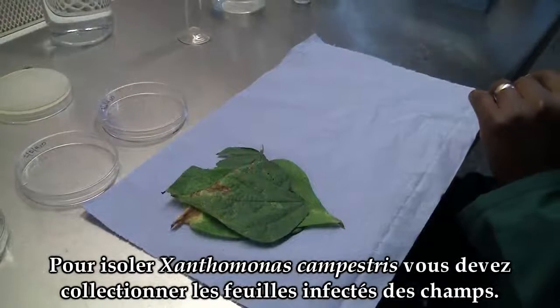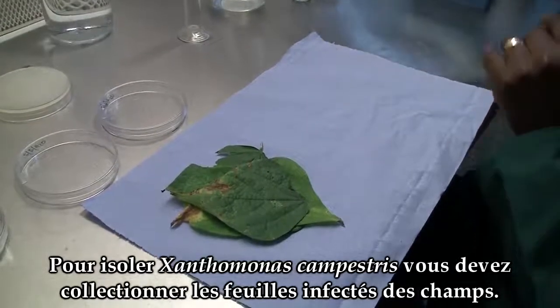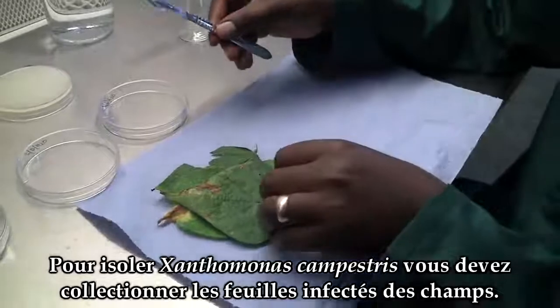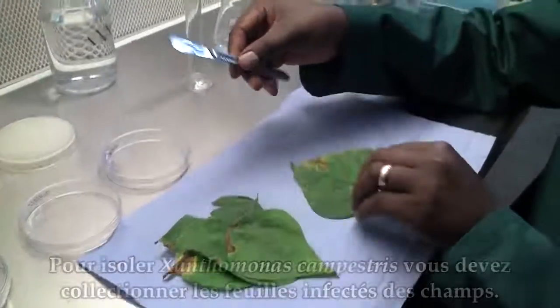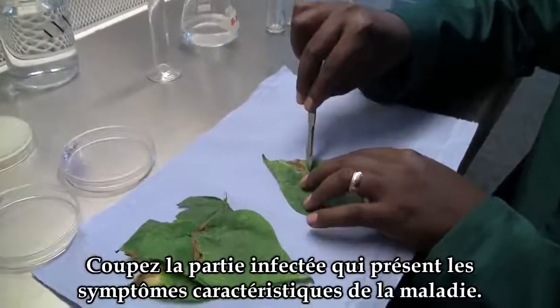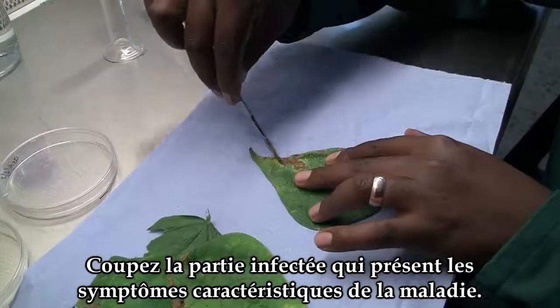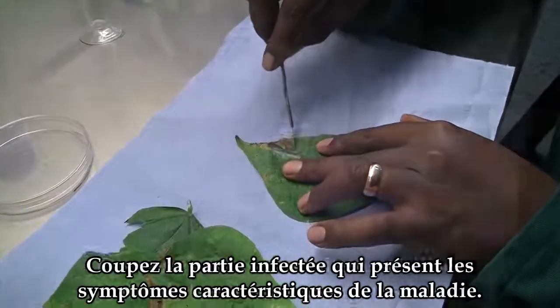To isolate Xanthomonas campestris, you will need to collect infected leaves from the field. From the infected leaves, you cut off the infected part showing the typical symptoms of the disease.